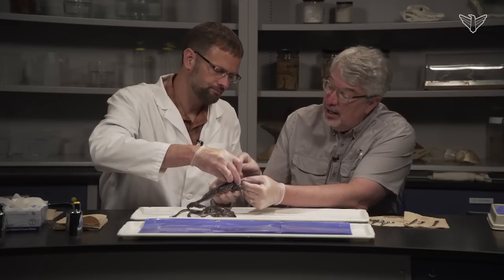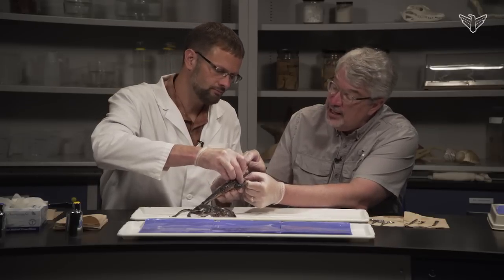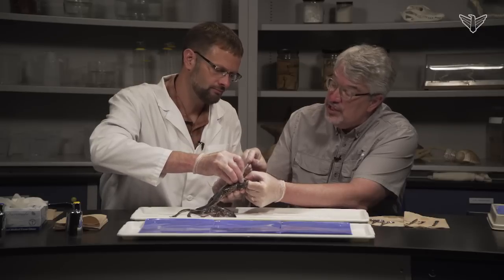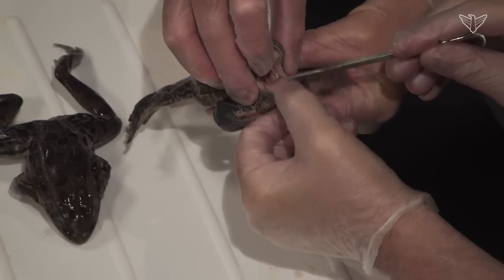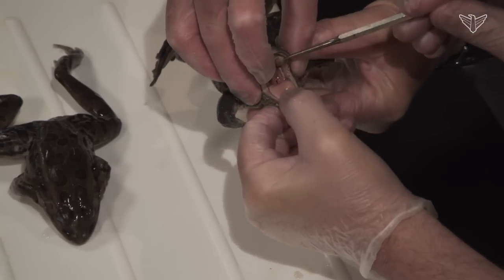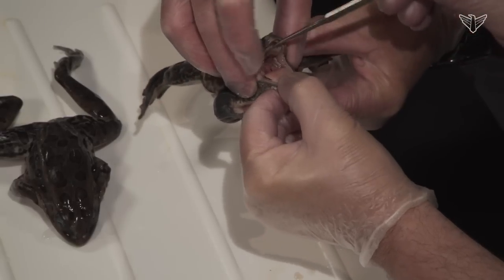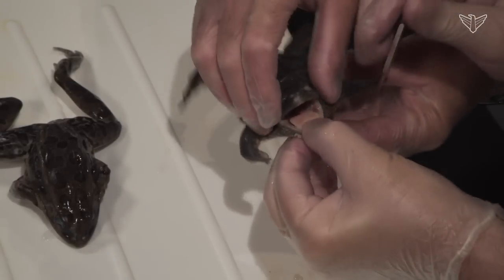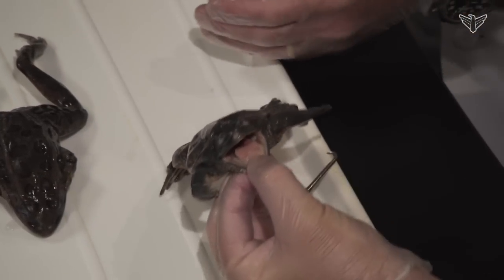Down here is the opening to the esophagus — the opening to the digestive tract.